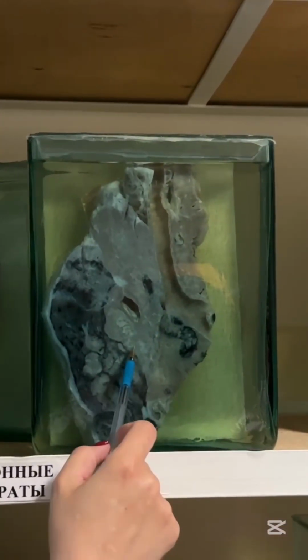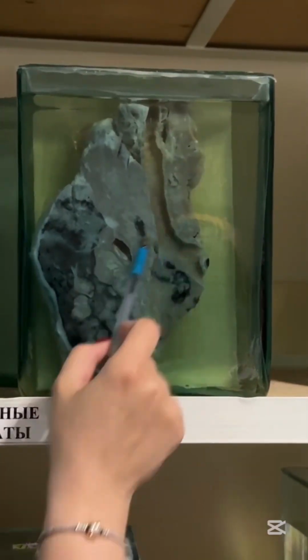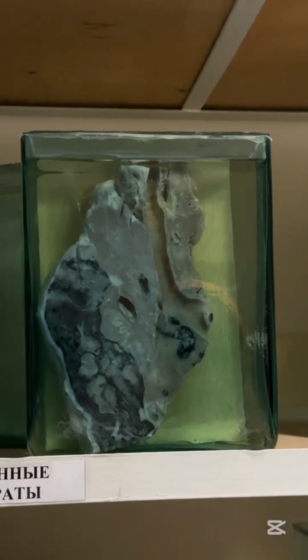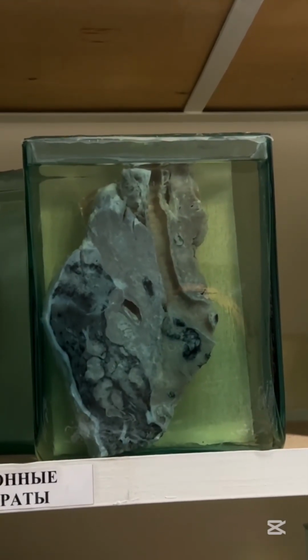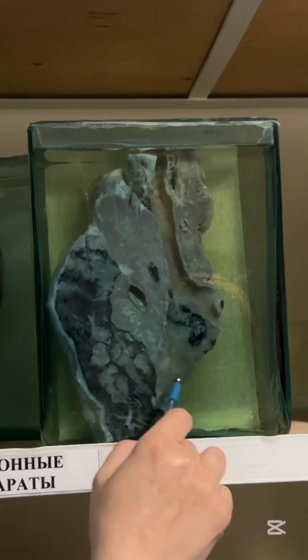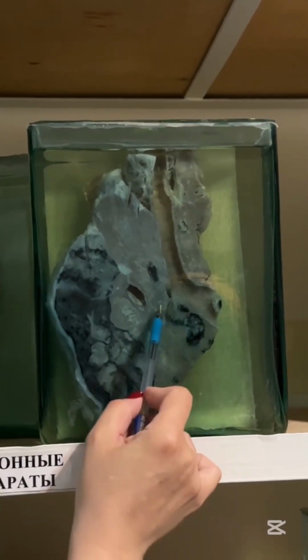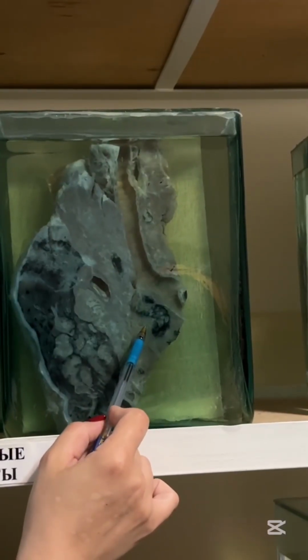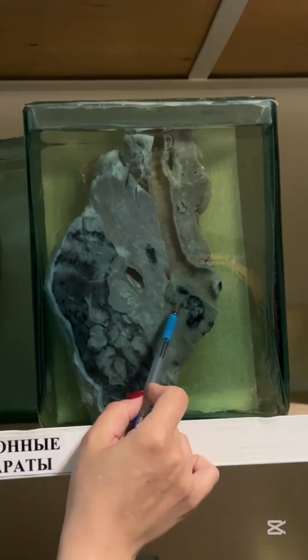Trachea, bronchi, that is lung, and you can see large whitish tissue, that is lung carcinoma, hilar or central type because it arises from large bronchus. Peripheral type usually in periphery of lung, that is central type. This is tumor. What else can you see? Bifurcational lymph node and same white tissue, that is lymphogenic metastasis. From this tumor to regional lymph nodes, lymphogenic metastasis.